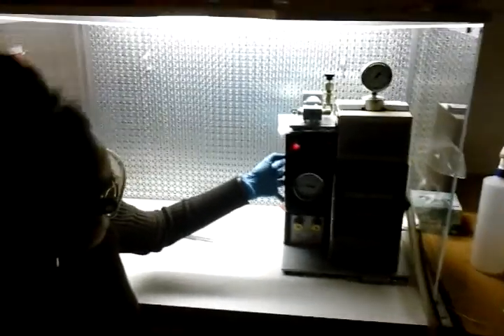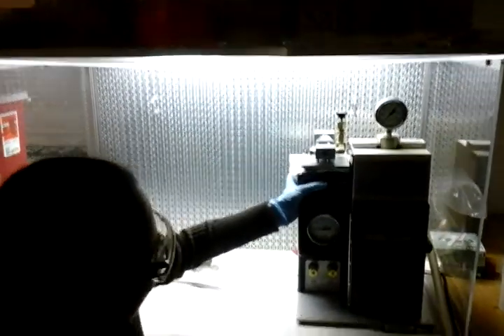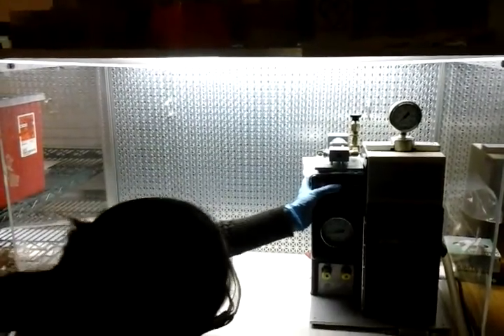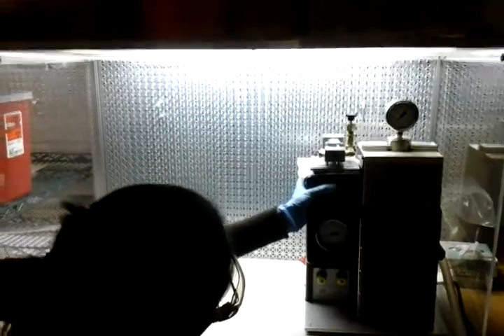What is the trigger? That is the trigger. Right now we're only working on the vacuum — we're only generating a vacuum. Inside, we're almost to where my target is.